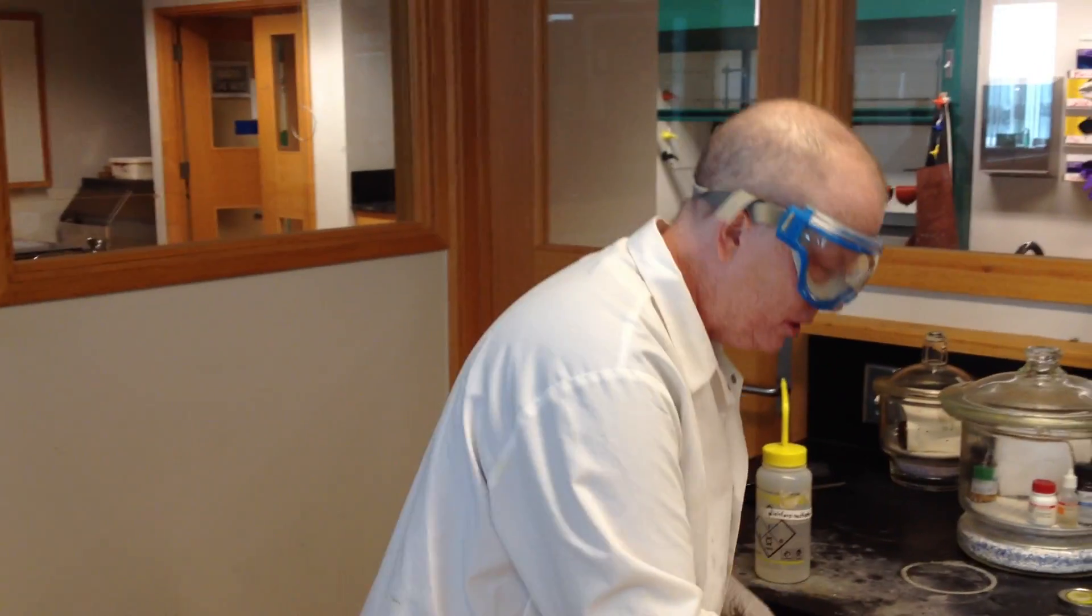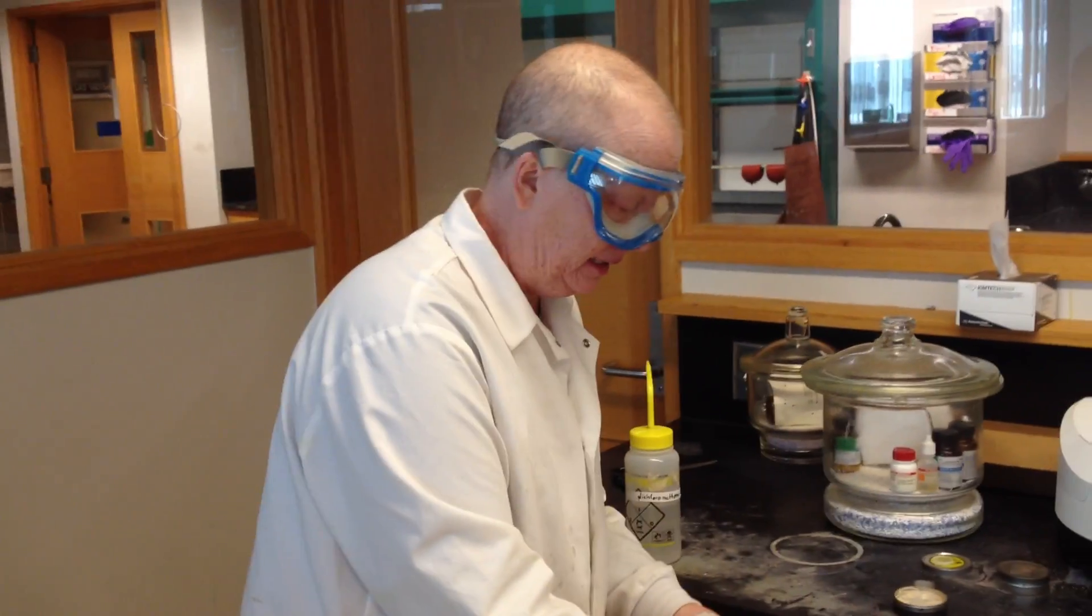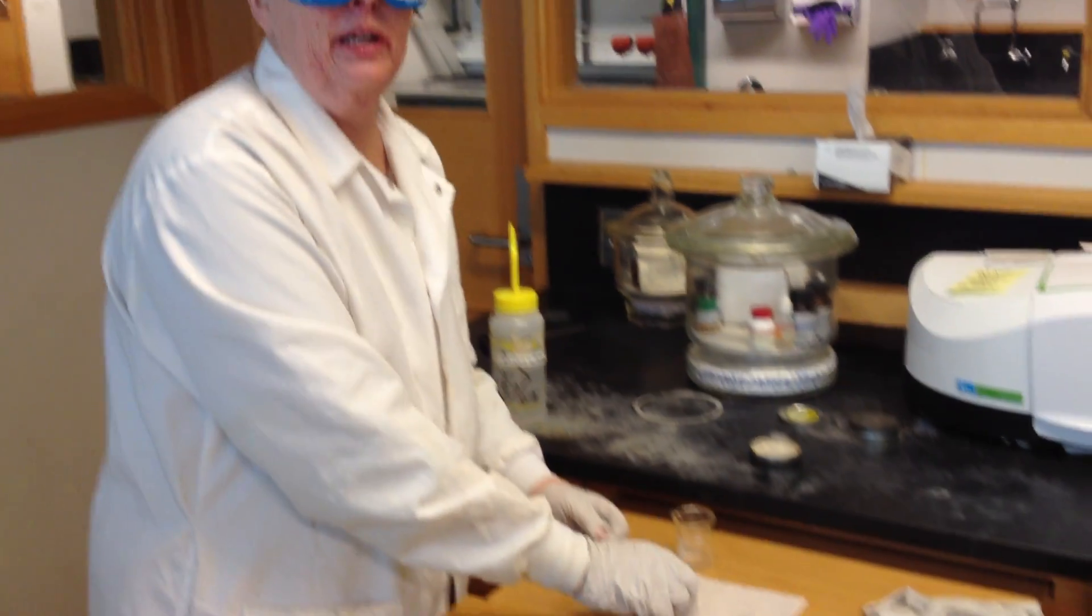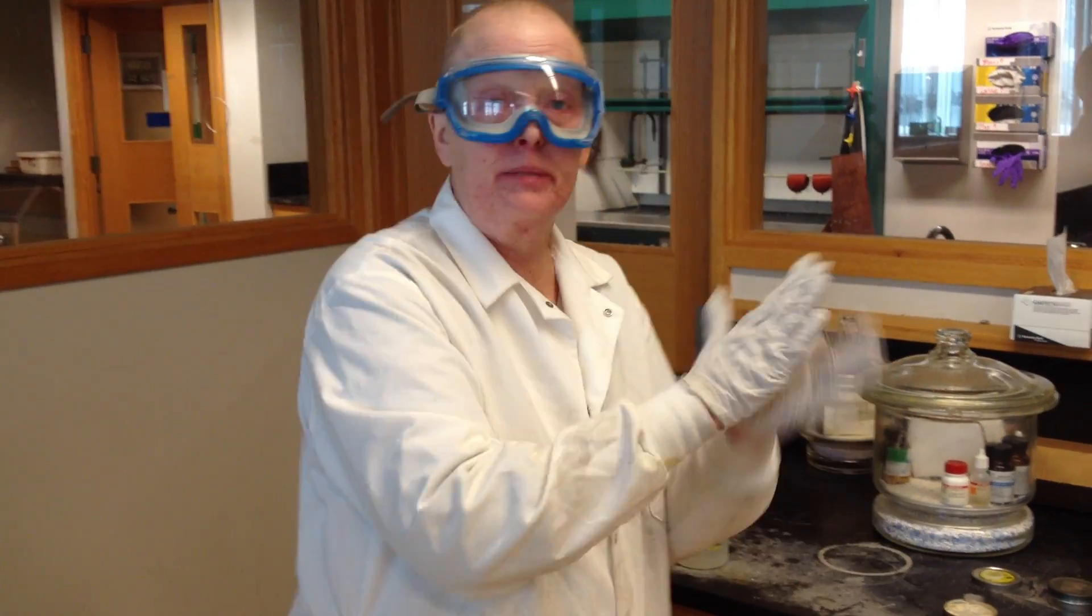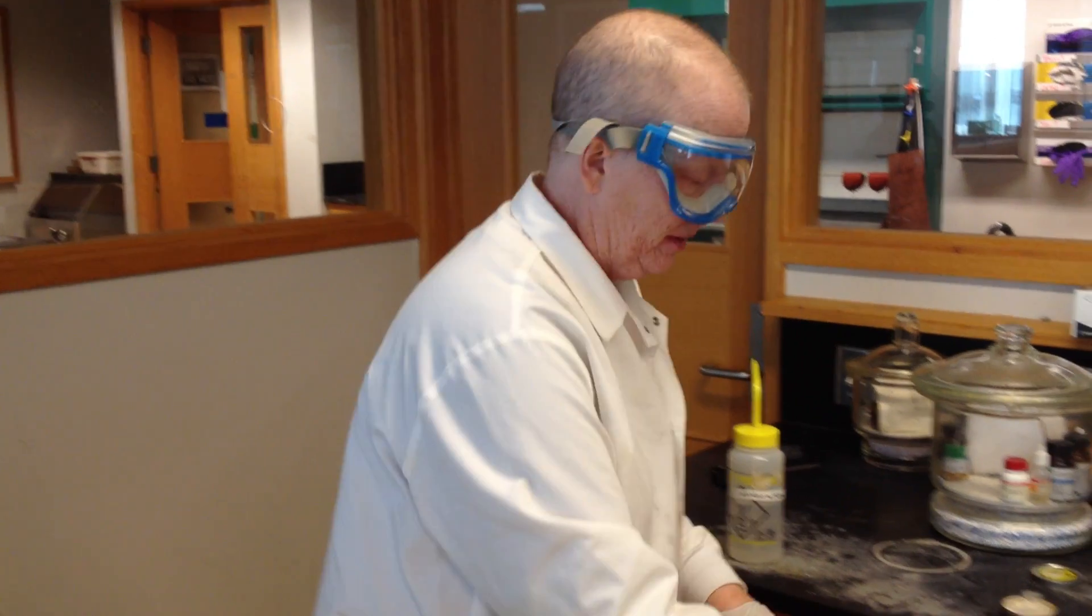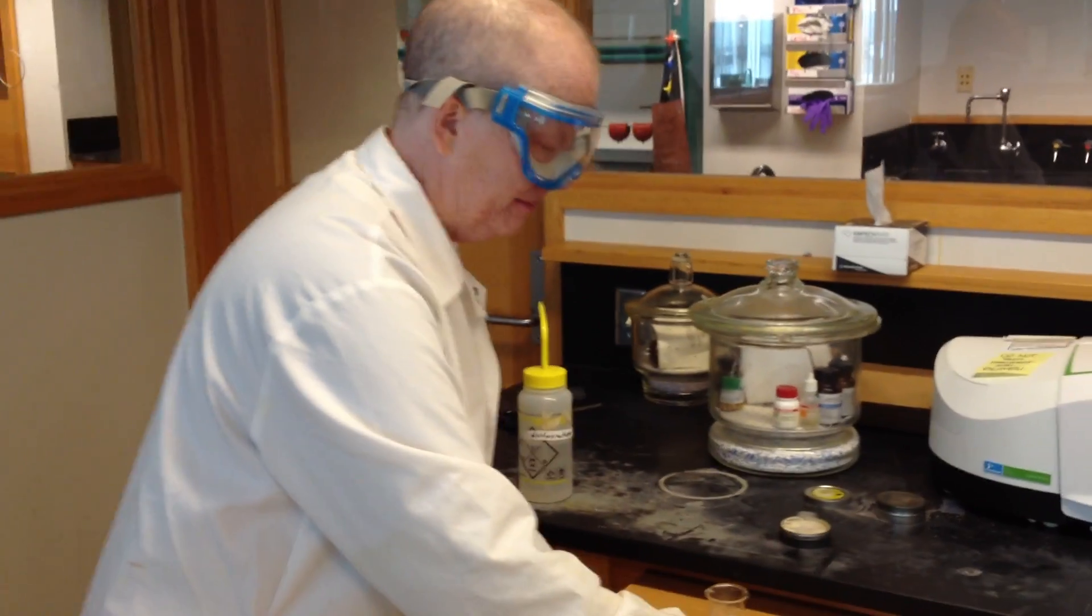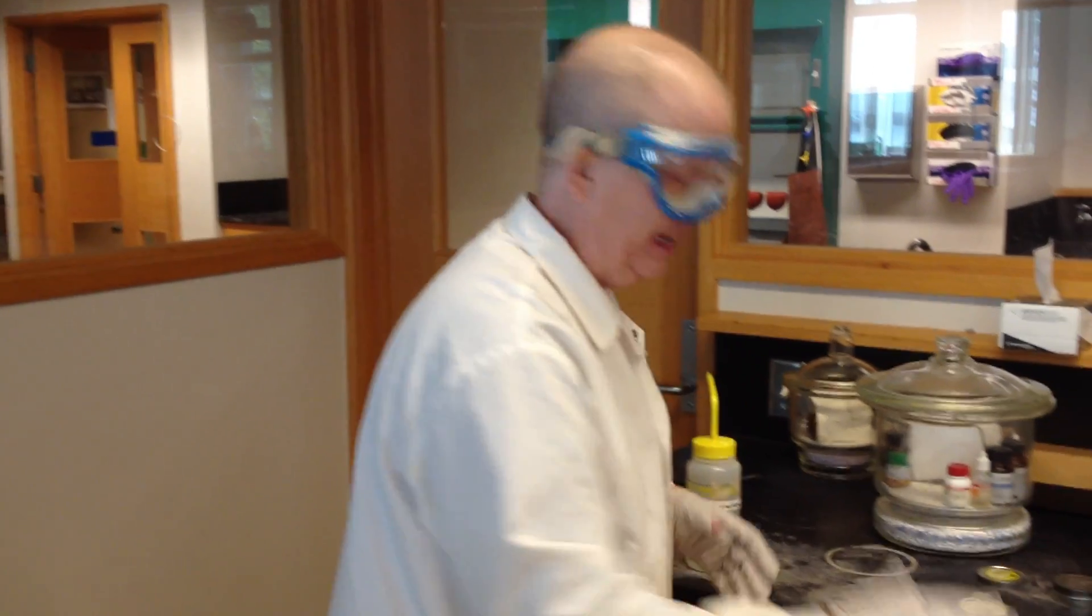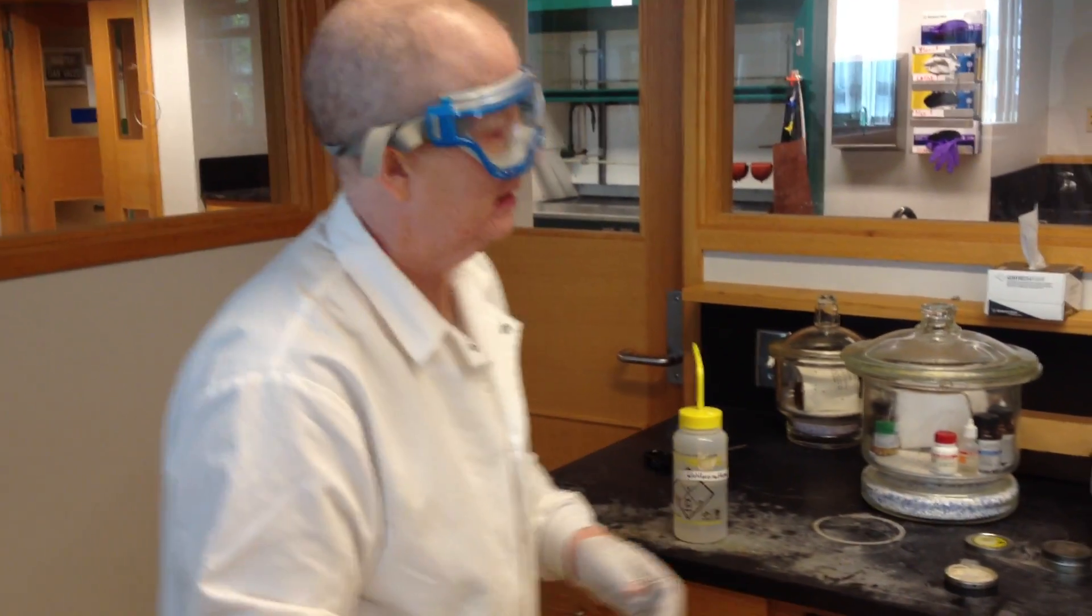So, how do you run liquids? If you're really running a true liquid, which you will also do many times in the lab, you just put a drop of liquid on a plate, a clean plate. Then you take a second plate, and you sandwich it. You really want it to stay a liquid, so you have to cover it up to keep the liquid in there. I always call that running an Oreo cookie. Running a solid is like running a half of an Oreo, and it's like you just have the cream part in there. It's half of an Oreo. It has to be bone dry.